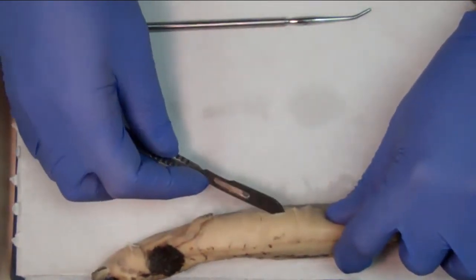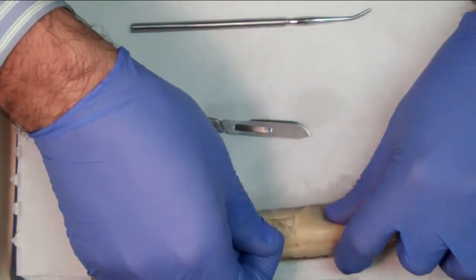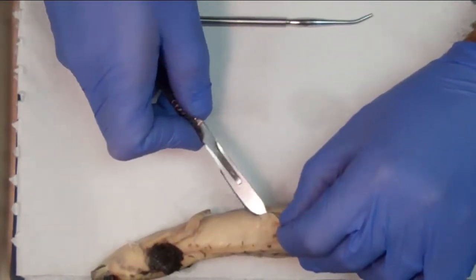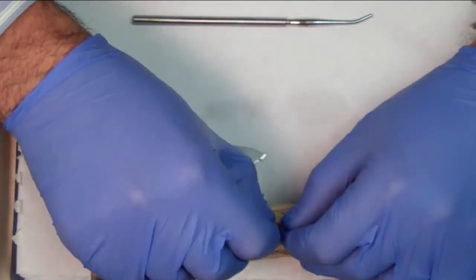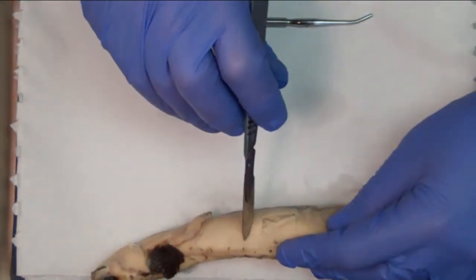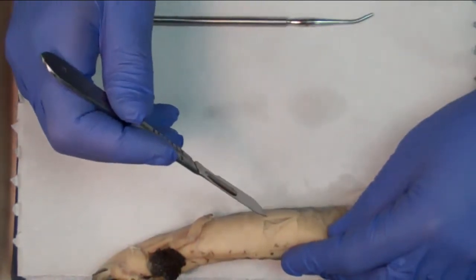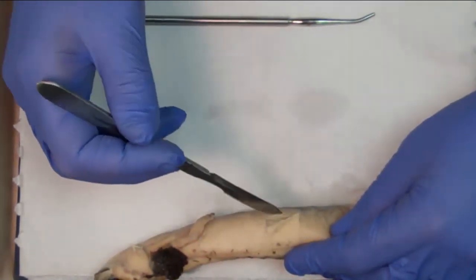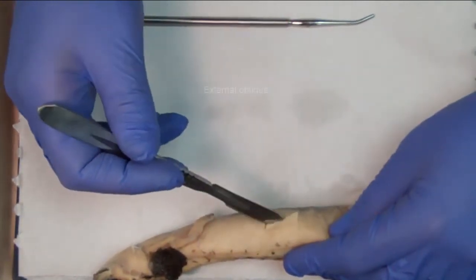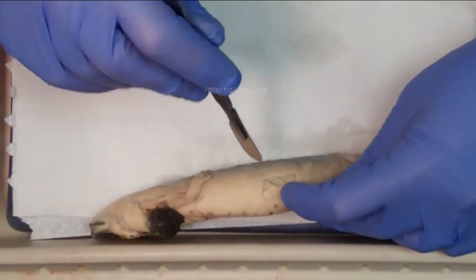If you peel it off, you see that the fibers start to point in the opposite direction. I'll get there. The section is halfway done, but I'll get there. You can see that the internal musculature, the fibers in the external one were pointing this direction, and the internal is this one. This tells you that the abdominal muscles of the hypaxial musculature are going to have another layer that is the external oblique, and an inner layer right there that is going to be the internal oblique.